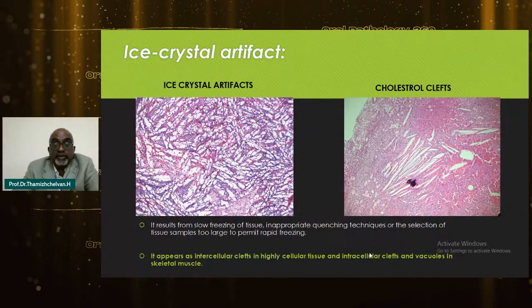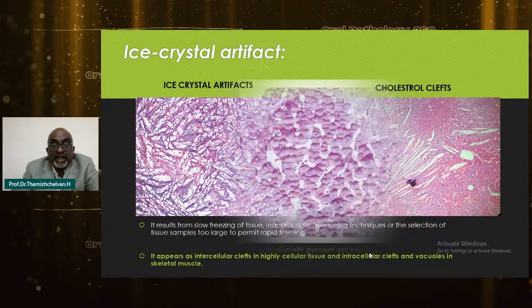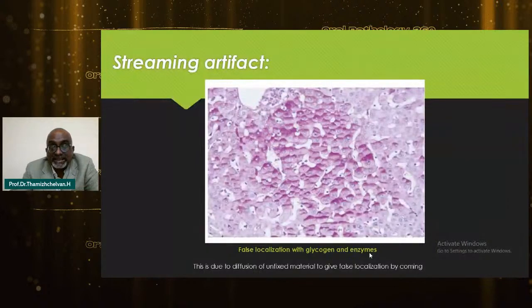This also happens because of quenching techniques. When you use inappropriate slow freezing, on the left you get this ice crystal artifact, which is almost similar to cholesterol clefts in a radicular cyst. This can cause a lot of problems in your day-to-day diagnosis. For example, ice which is not properly frozen or not kept properly can give all these problems. You also have the streaming artifact because of false localization of glycogen and enzymes here.